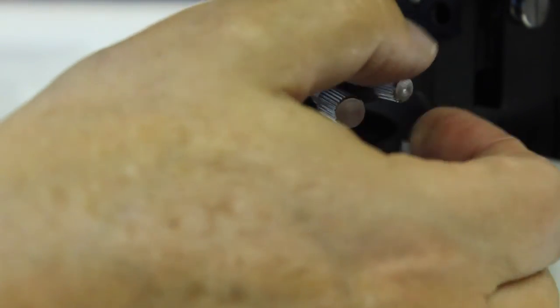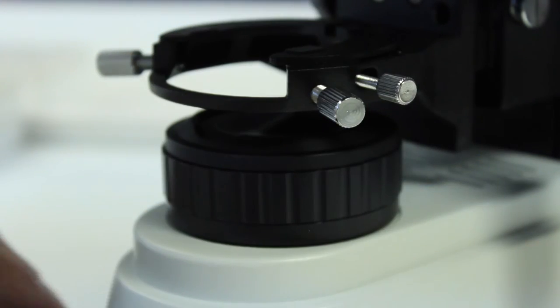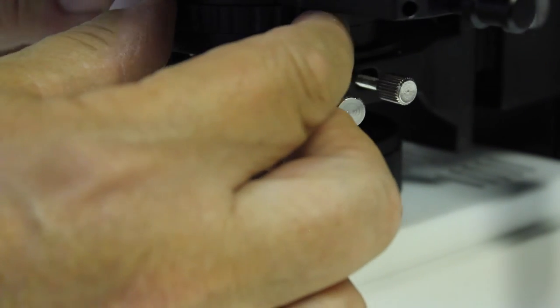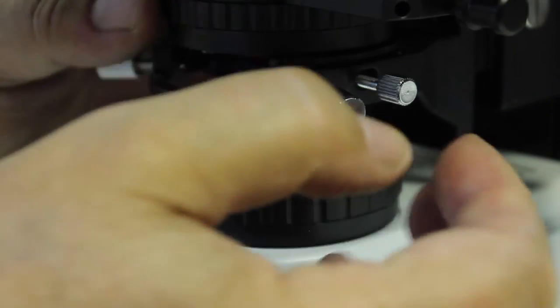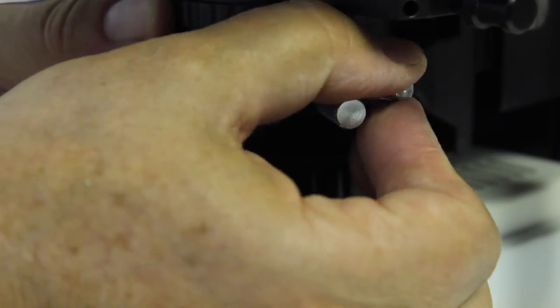Just unscrew this chrome nut. Don't take it all the way out, but make sure that it's not poking through the black part of the arrangement. Then we're just going to slide the condenser back in and get it into place, and then tighten up this thumb nut on the side.